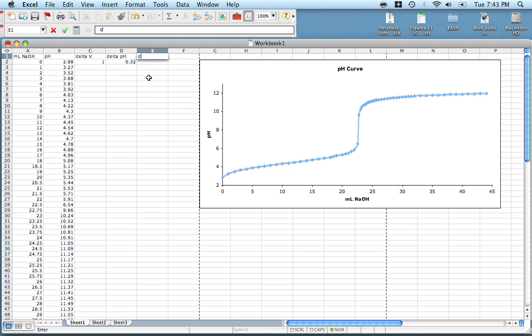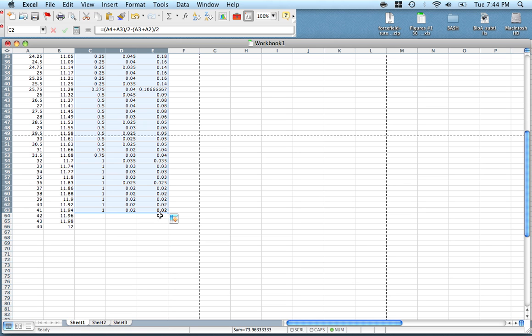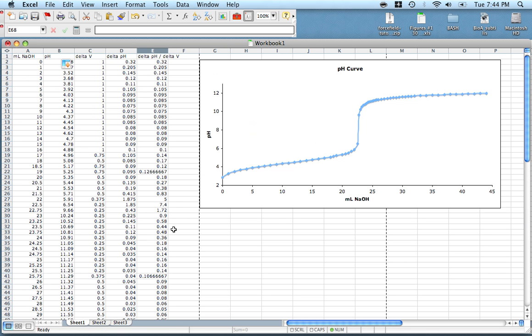And then our delta pH divided by delta V is just D divided by C. So we don't have to type that in each time down here. All we have to do is select all of these columns, put our cursor over the blue box, and click and drag all the way down to here. The reason why I didn't do the last, actually I can do the last 3. There we go. The reason why I didn't do these last 2 points is because there's not a third value in each of these sets, so it wouldn't give us a real number.